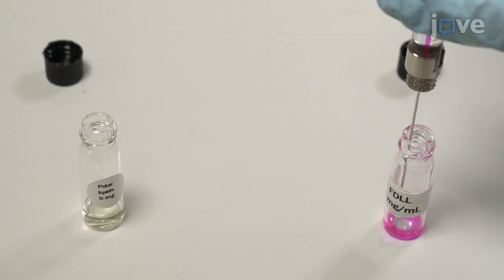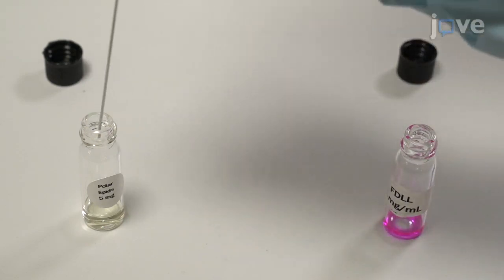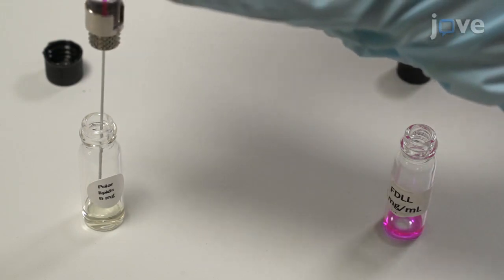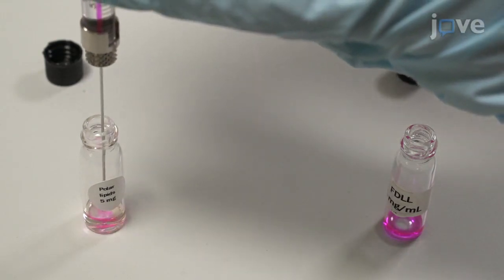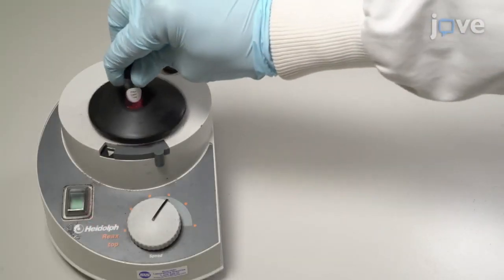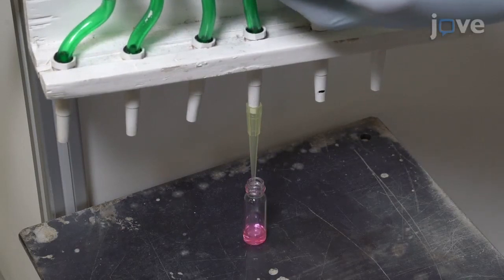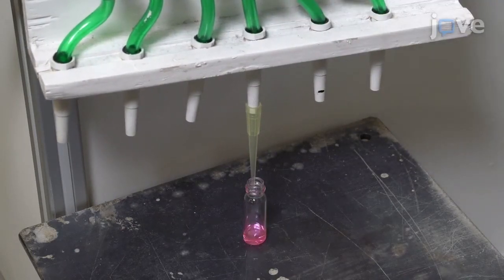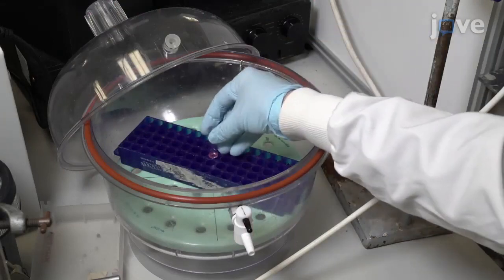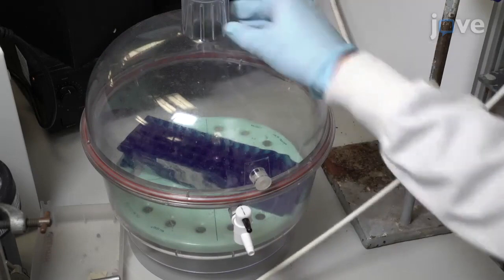To the mixture, add 20 microliters of 1 mg per milliliter long wavelength fluorescent dye-labeled lipid, abbreviated FDLL. Homogenize the chloroform solution by short vortexing, and evaporate most of the chloroform under a gentle nitrogen or argon flow. Remove the chloroform traces entirely by further evaporation under vacuum for at least 1 hour.